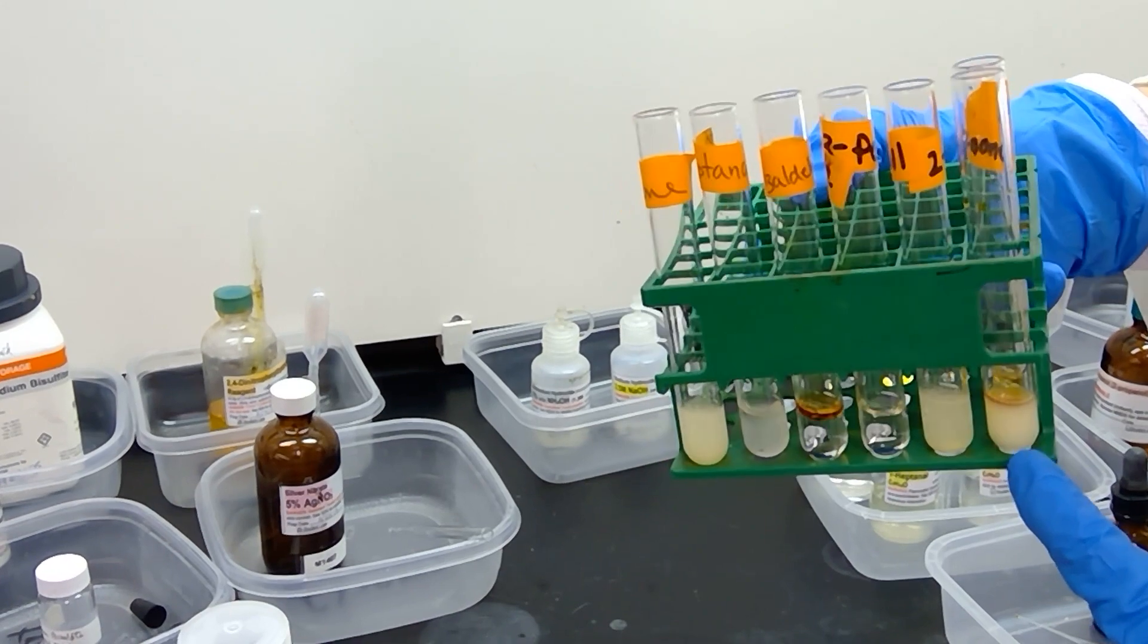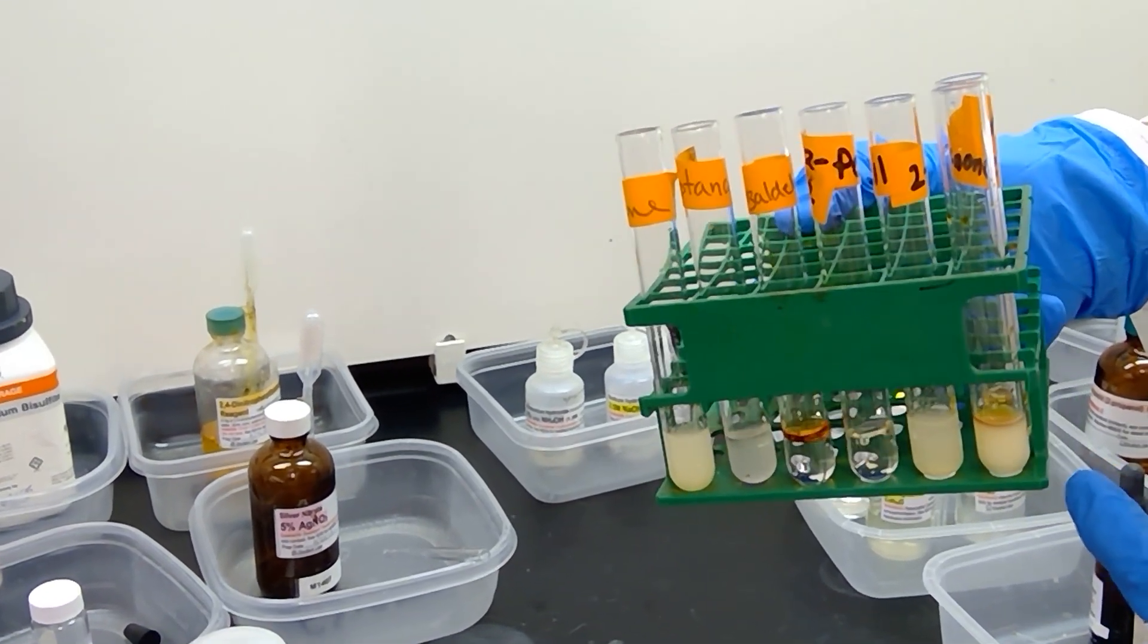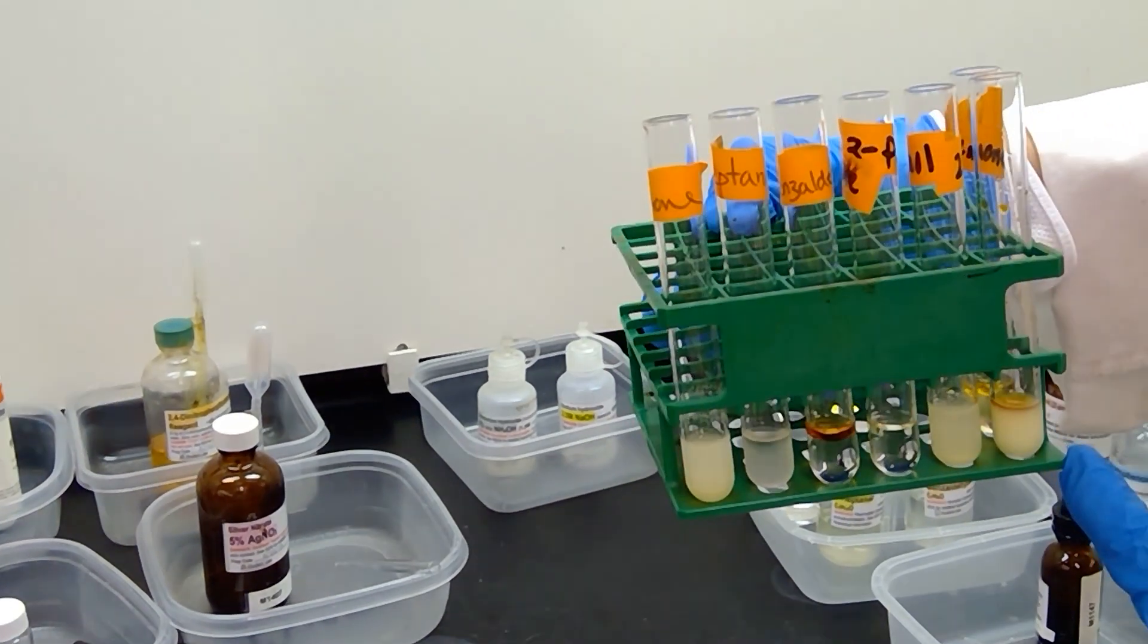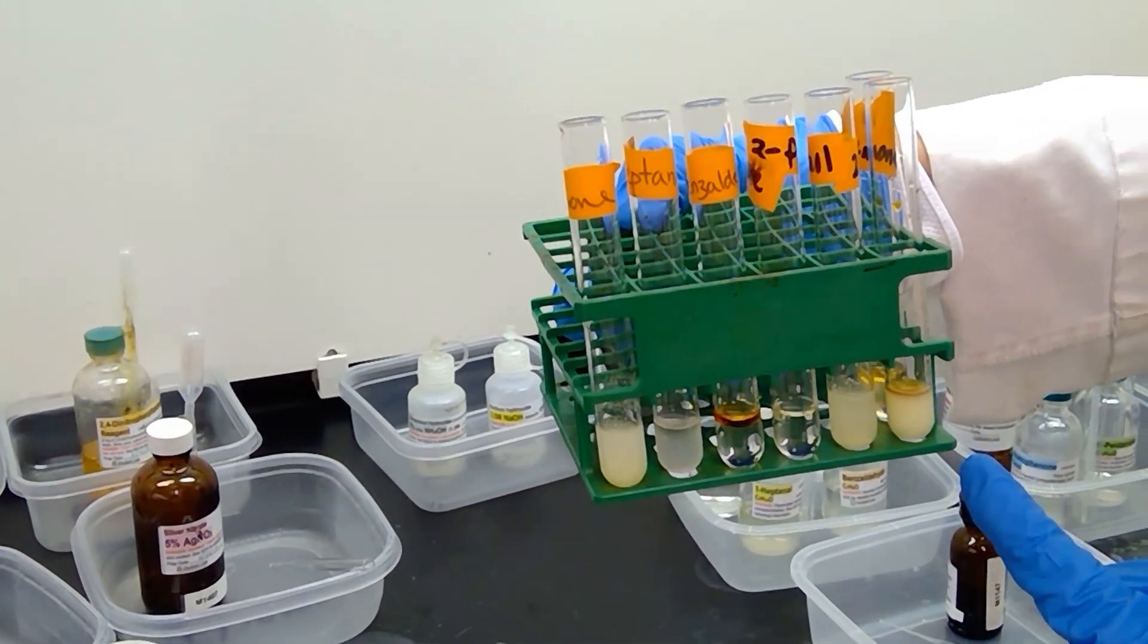We anticipate that we should get a positive reaction here, since acetophenone is a methyl ketone. This is the final conclusion to the iodoform test.